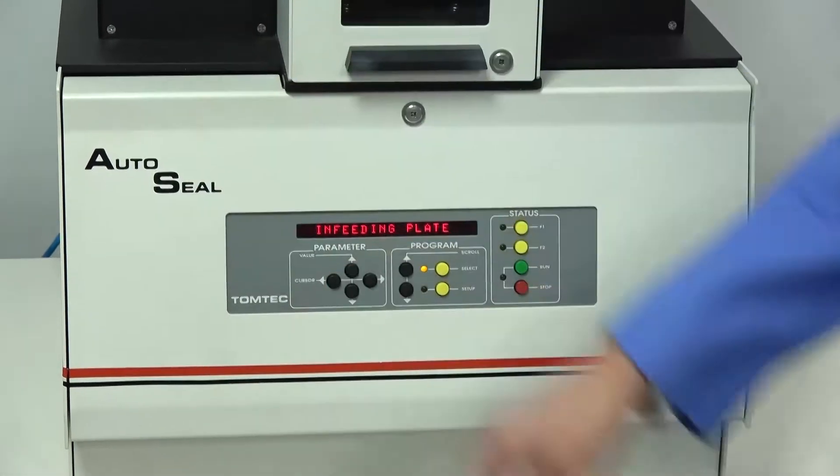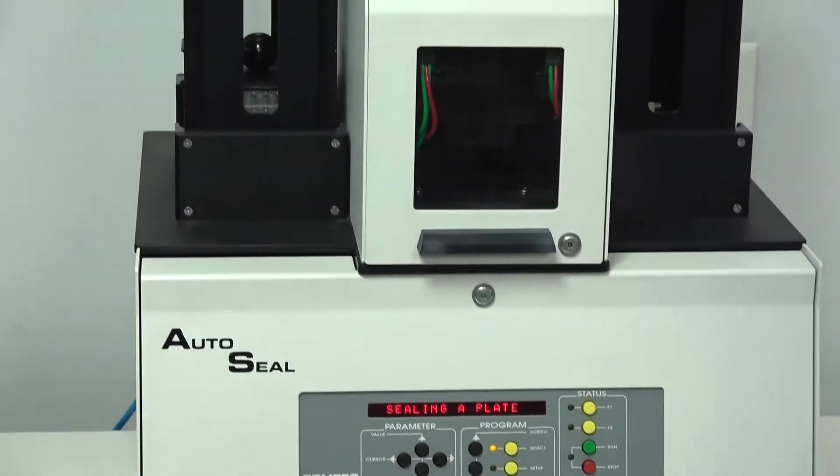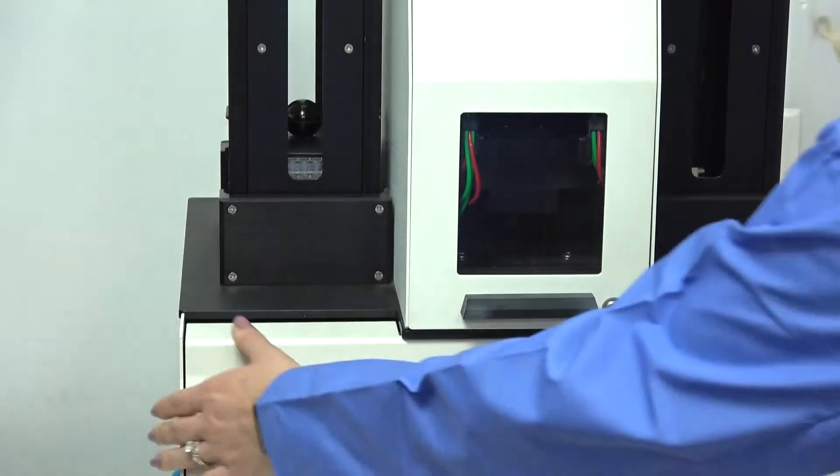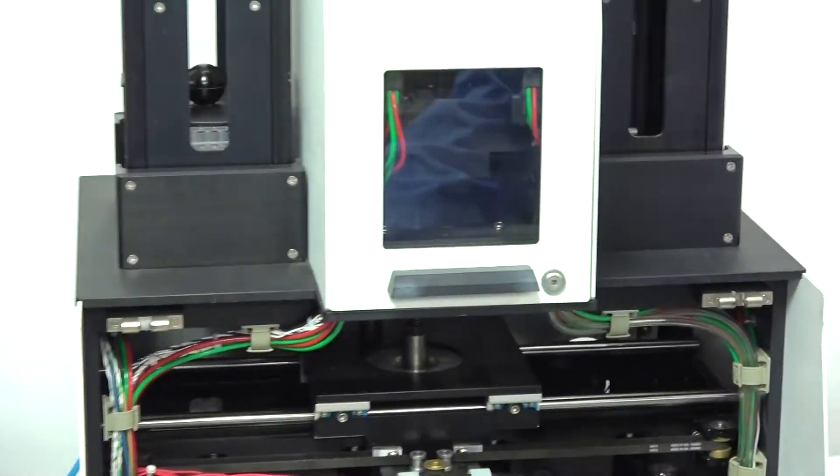Your microplate will be fed onto an elevator mechanism which is located inside the unit.